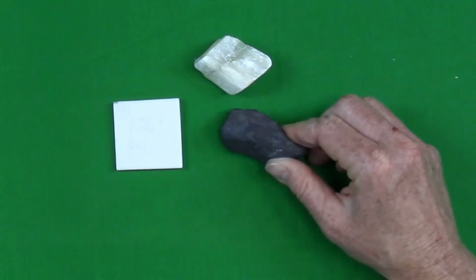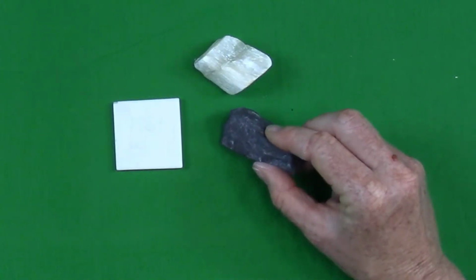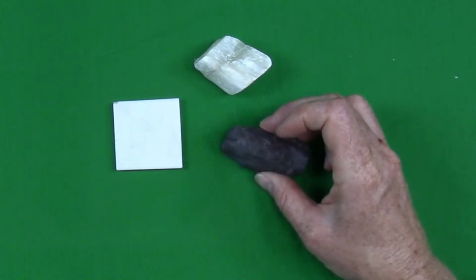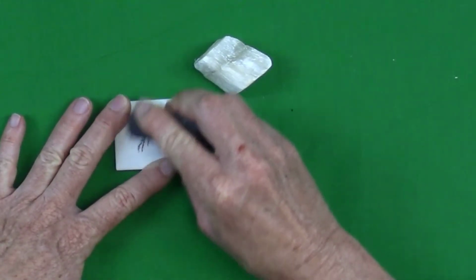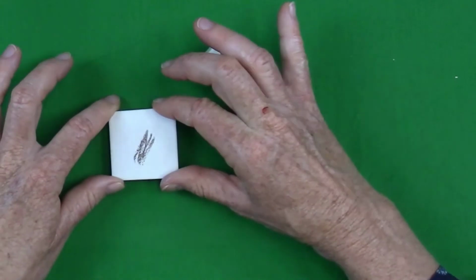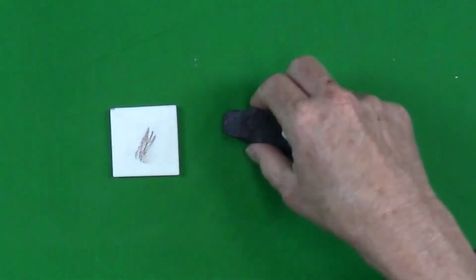This is a mineral called hematite, and it comes in a variety of colors. Sometimes it's kind of a metallic silver color, sometimes it's a rusty red color, and sometimes it's a very shiny, reflective silver color, and sometimes it's more black and metallic looking. But every time we streak hematite, the color on the streak plate is a kind of a rusty brown or rusty red color. So in that way, streak can be a more diagnostic color test than the actual color in hand sample.